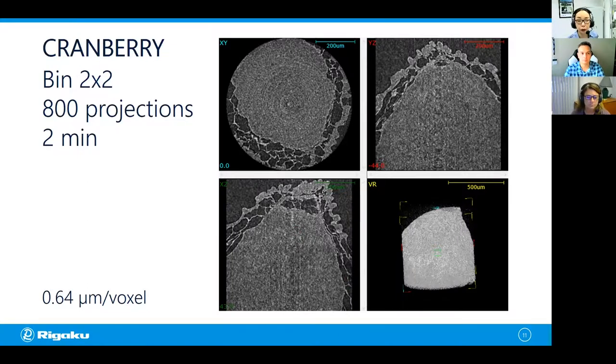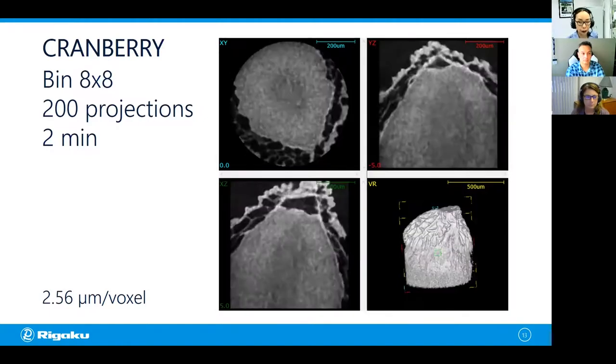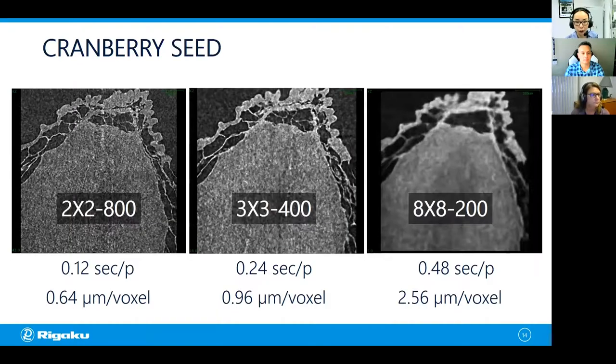If you do 3x3, 400 projections, the voxel size becomes a little bit larger, 0.96 microns, and the image becomes a little bit less noisy. But you can still see the details. If you go all the way to 8x8, the noise level goes down quite a bit, but the voxel size now is 2.56 microns, and that is not enough to see all those details between the core of the seed and the skin. Let's take a look at them all together.